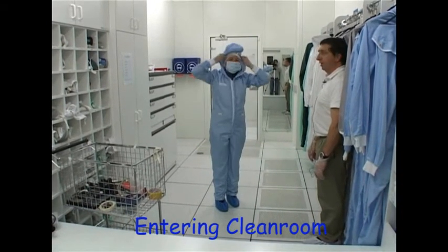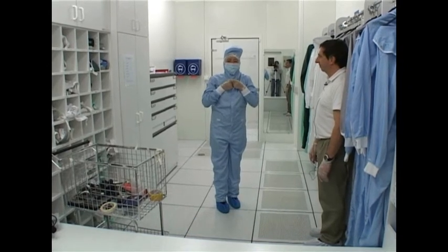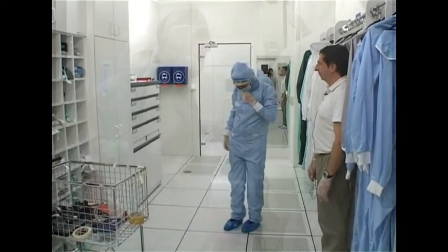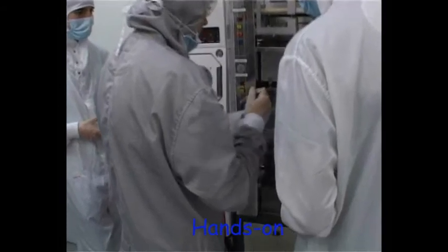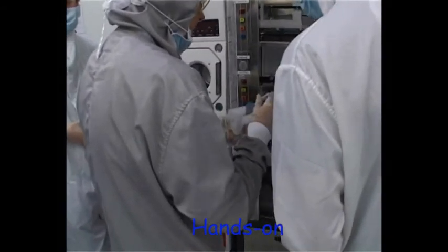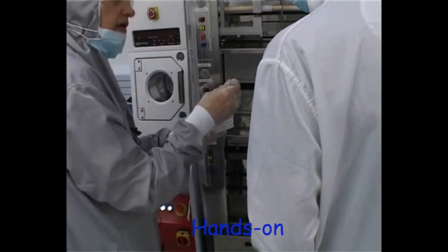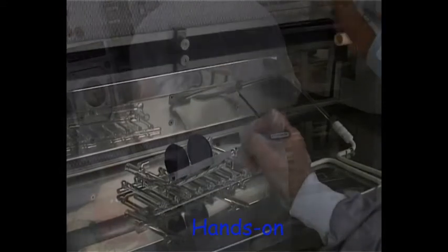Then you cover your head again. And this one is cross-threaded, for example. Yes. Okay? So this is not a good way to do it. And you also have to put the polished face on this side. Okay, you go ahead. Okay, so this is it.